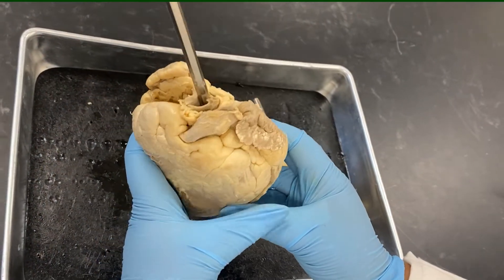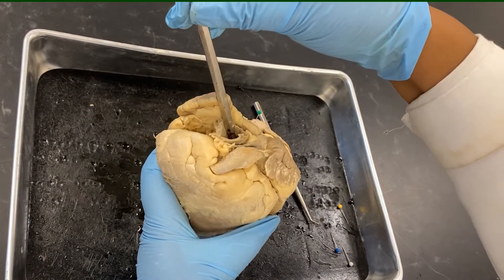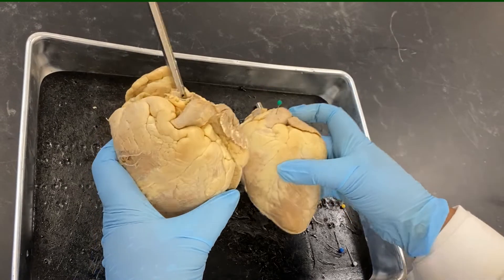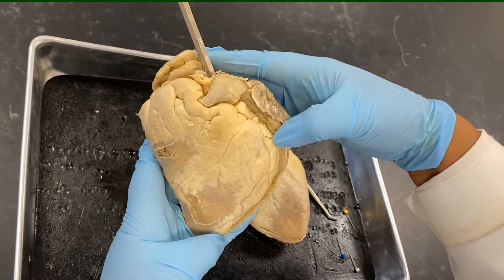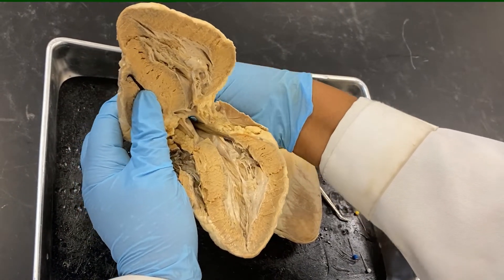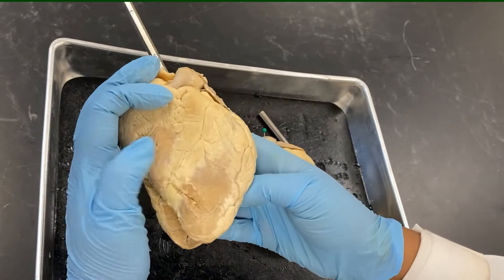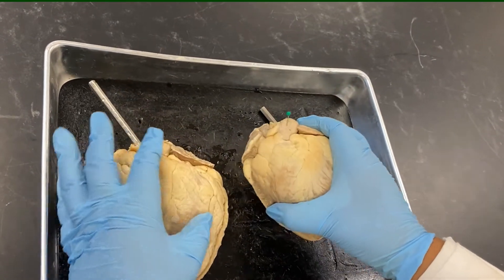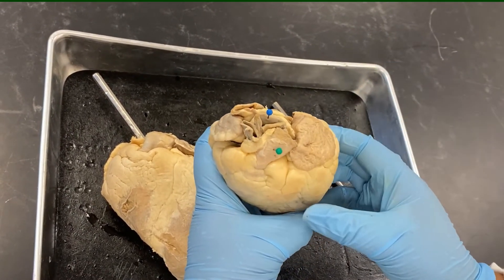The next blood vessel, posterior to the pulmonary artery, is the aorta. We can see the aorta from here as well. Let's follow the same tracking process with the probe — the aorta comes off from the ventricle. This is the left ventricle, the aorta comes off, and this is the aorta.